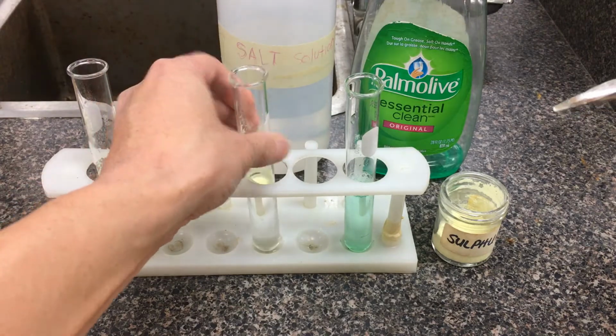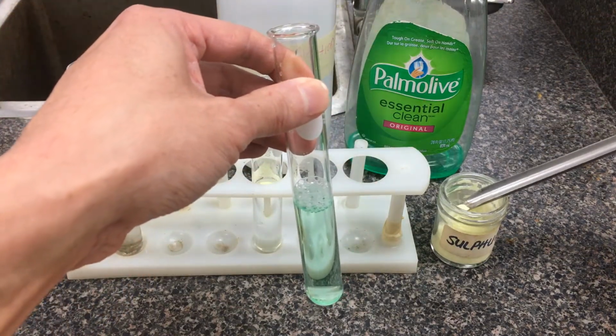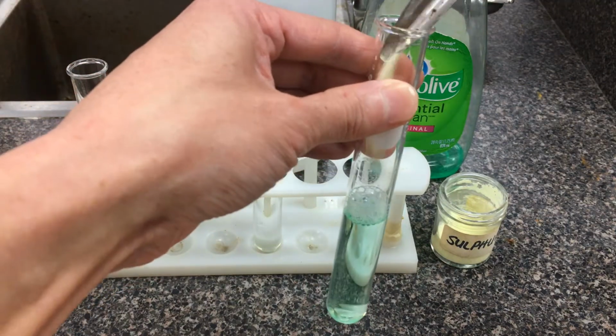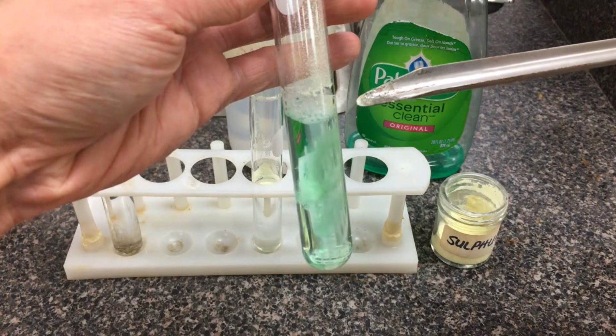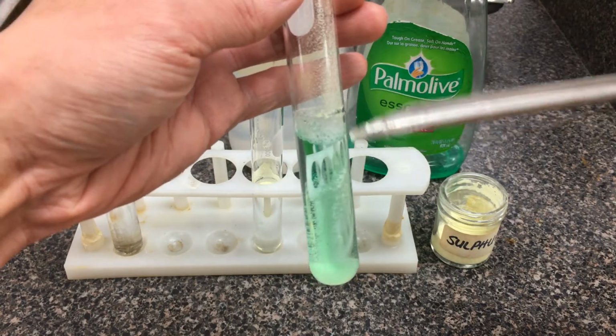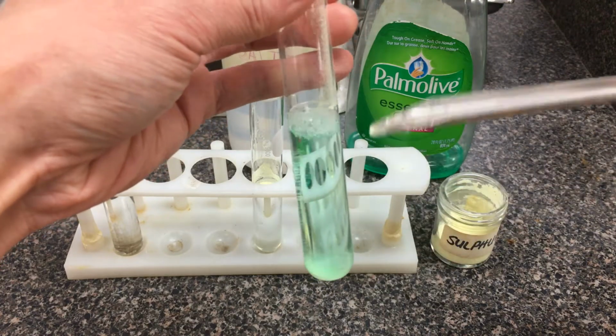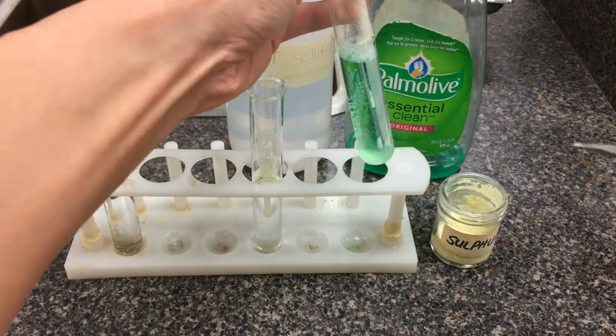And then we'll do the same here with our last solution, which is a soapy water solution. Again, take some sulfur powder here, drop it on top. So you do definitely see the sulfur powder there, but a very different impact here. It didn't stay on top for very long. I don't even need to tap it, and it's actually settled down towards the bottom. So again, we can just make some qualitative comparisons of what we saw.